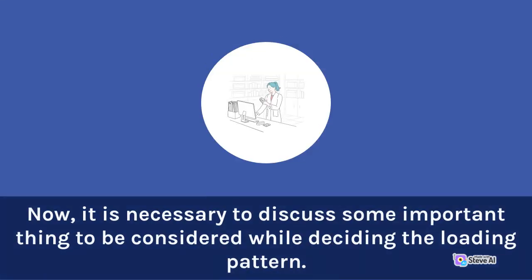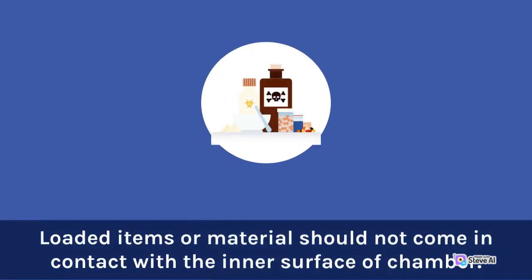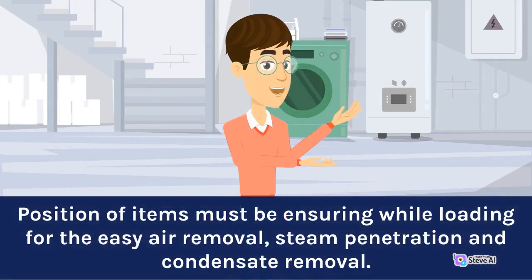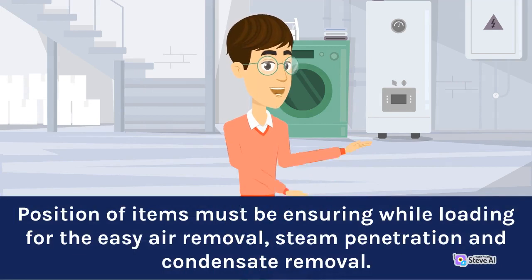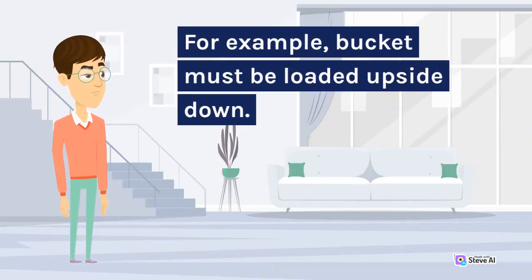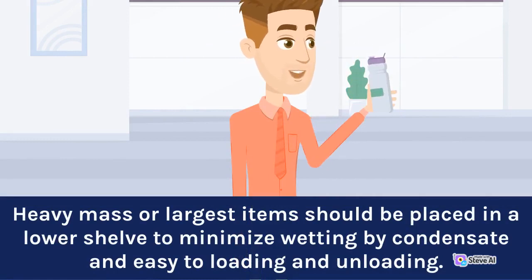It is necessary to discuss some important things to be considered while deciding the loading pattern. Loaded items or materials should not come in contact with the inner surface of the chamber. The position of items must be ensured during loading for easy air removal, steam penetration, and condensate removal. For example, buckets must be loaded upside down. Heavy mass or largest items should be placed on a lower shelf to minimize wetting by condensate and for easy loading and unloading.